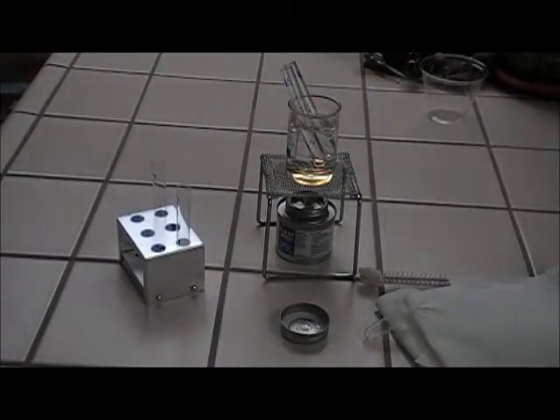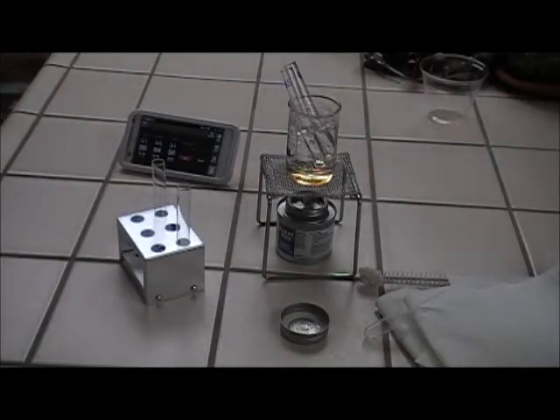Get a timer going. Alright, there's our timer.